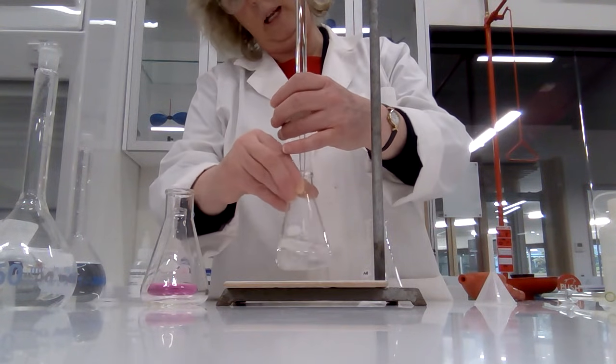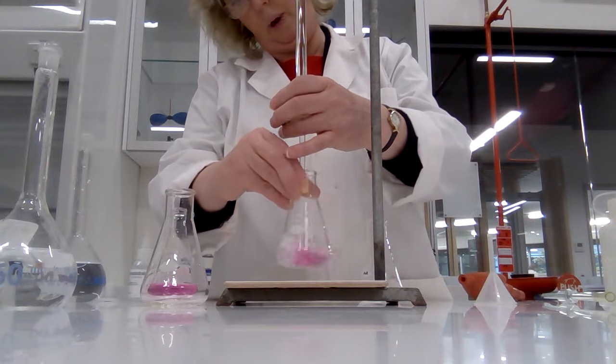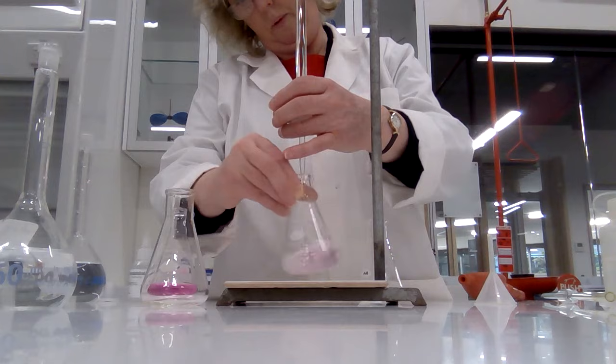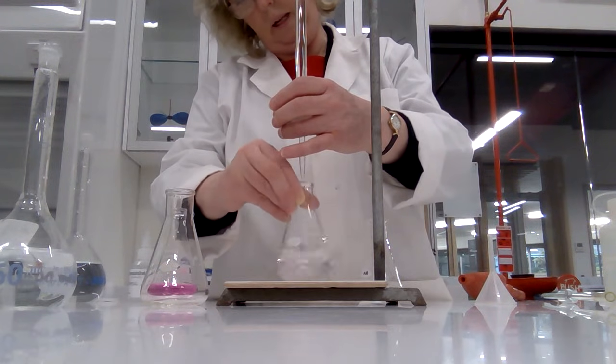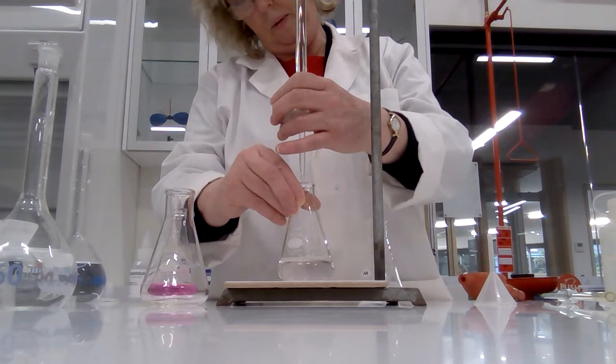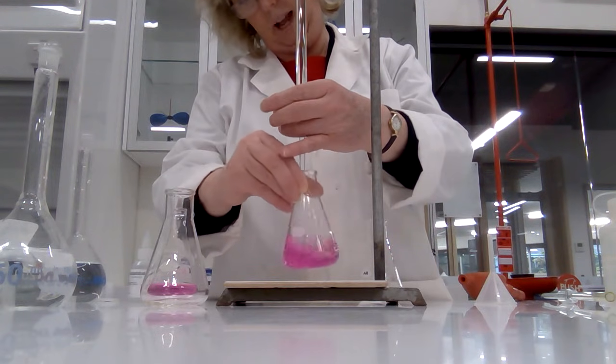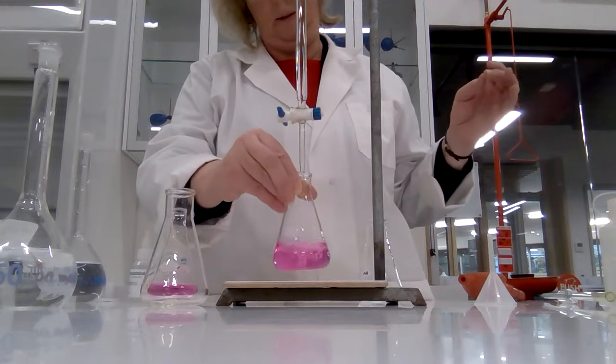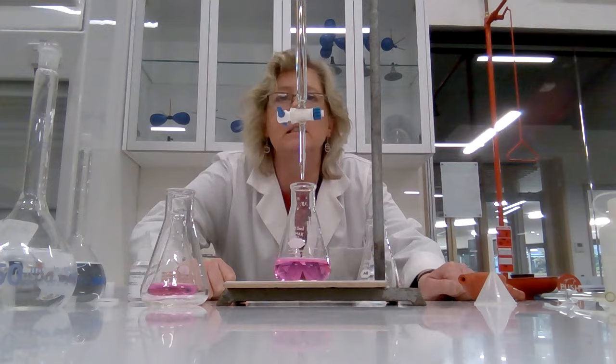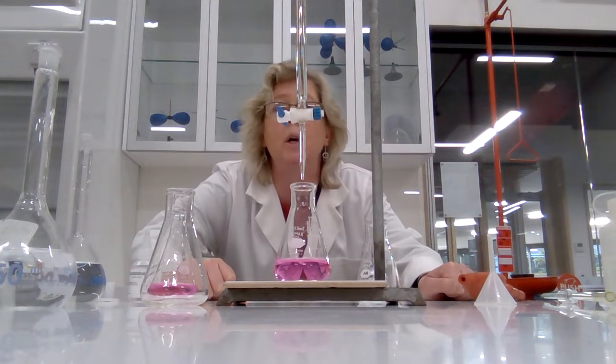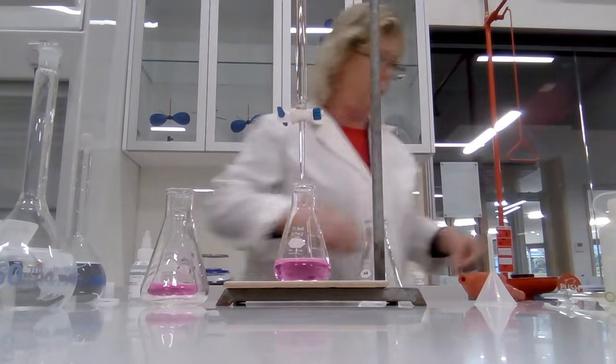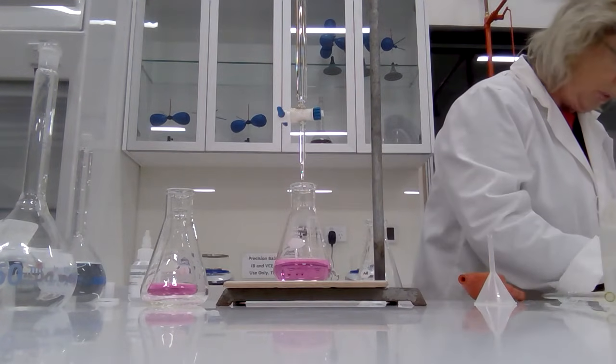It takes longer for the pink color to disappear when you're getting near the end point. Oh, very, very close. I reckon if I can get just one drop. Here we go. Oh look at that, happy days. One drop and the color has changed. So yes, considerably less than last time: 42.87, 42.70. So that was 20.0.